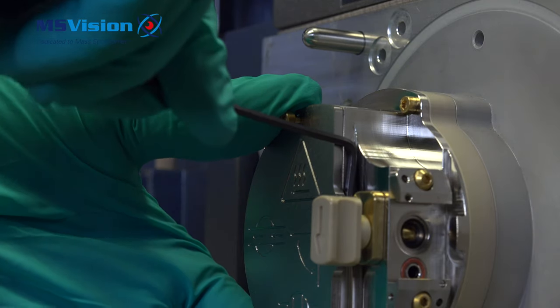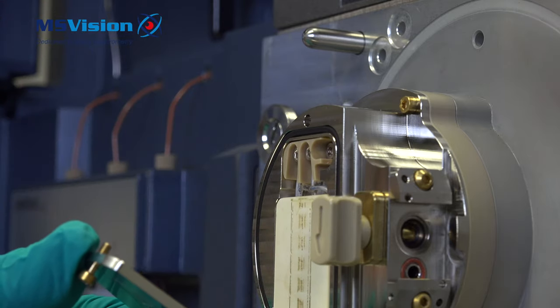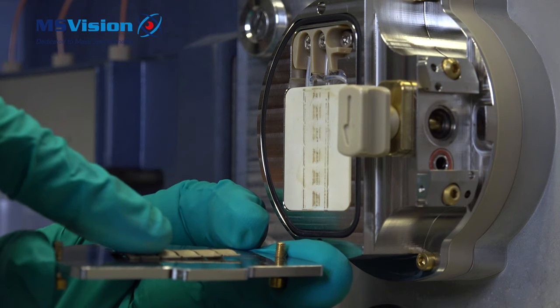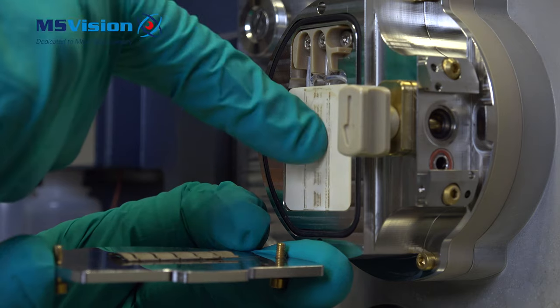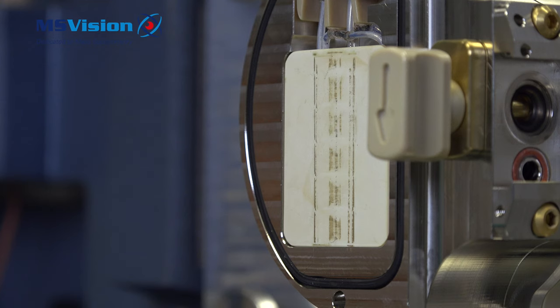If the heater plate is tight then use your allen key to remove. This here presses between the heater element and the front plate. It always is loose but originally was stuck to the element.